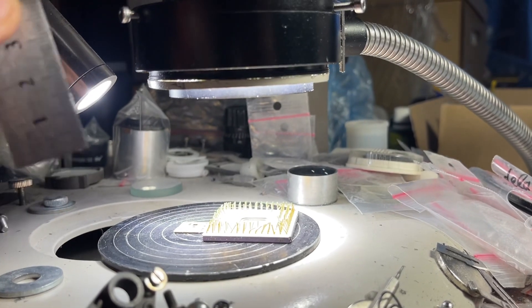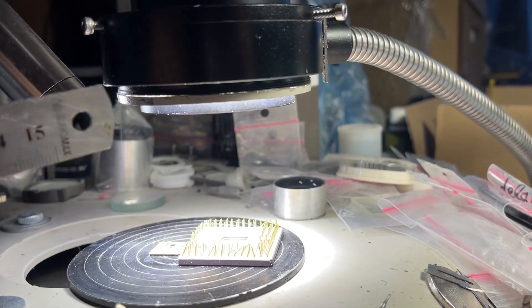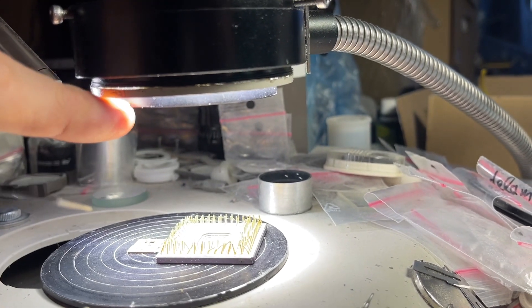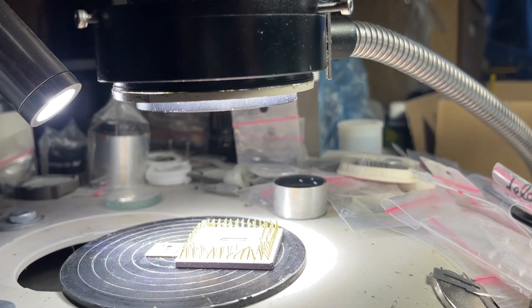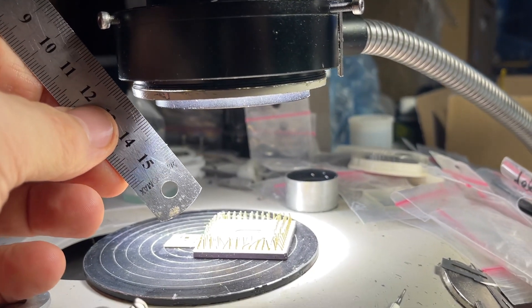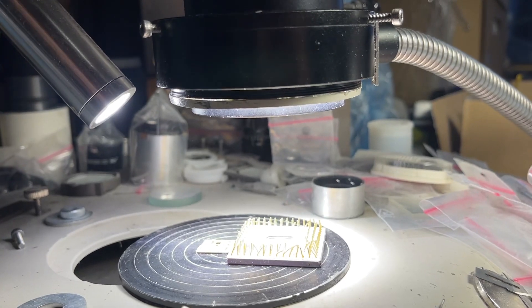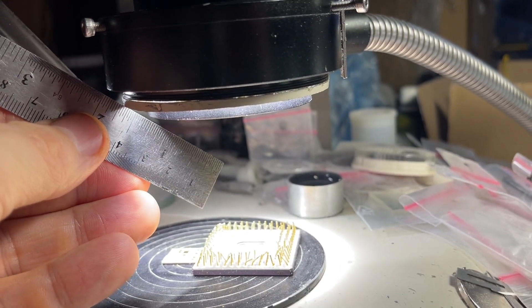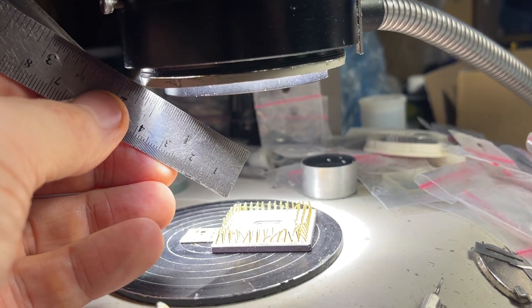By the way, if you use an objective with ring light, there's usually three to four millimeters from the objective that stick down. So technically it's not that bad to reach stuff because the ring that blocks a lot of our actions is five millimeters upper.